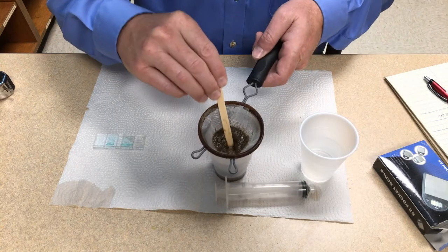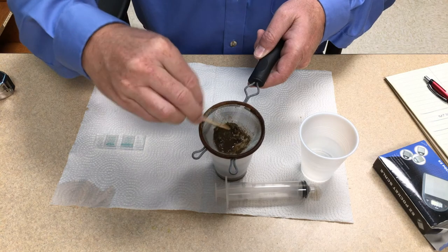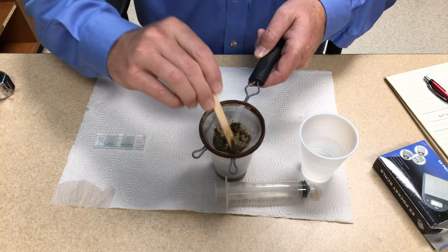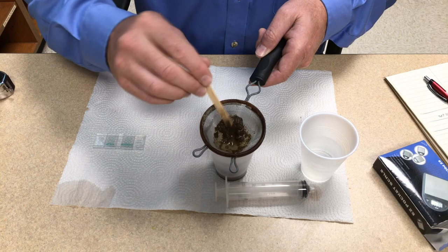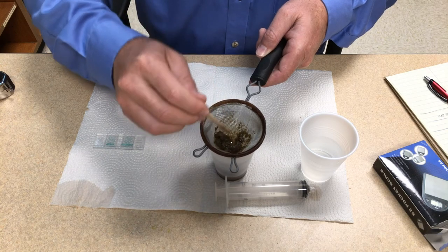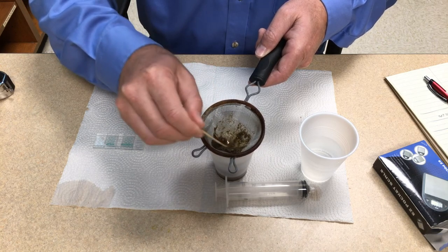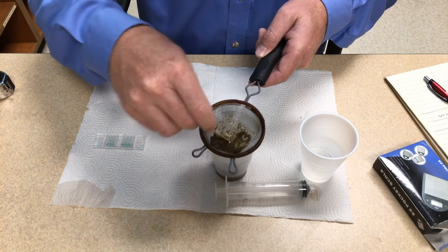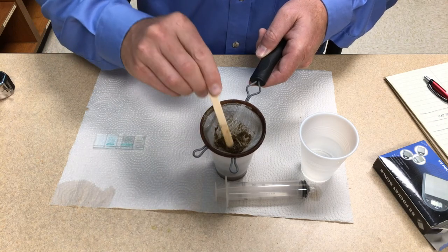Now that I've given my solution a couple of minutes to drain through the tea strainer, I'm using the popsicle stick to press more of the liquid through. Once I've done this, I'll take the remaining solids to dispose of them and I'll retain the solution for examination.